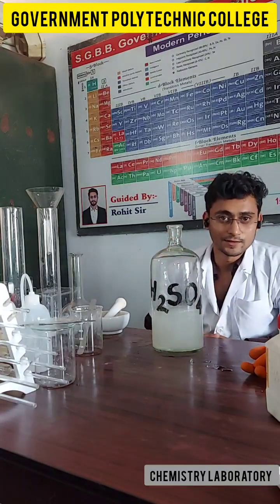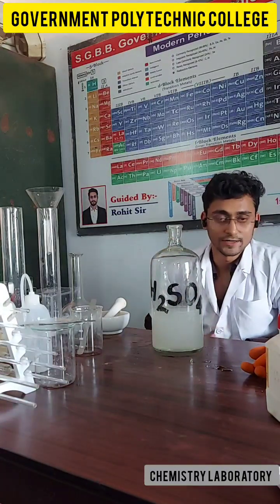So in this way, you can make the 1 molar solution of this disodium hydrogen phosphate.